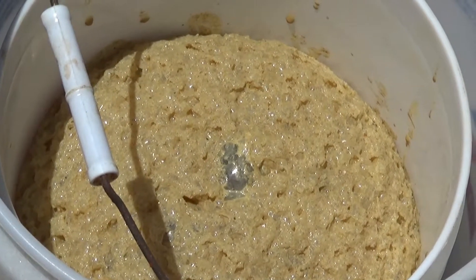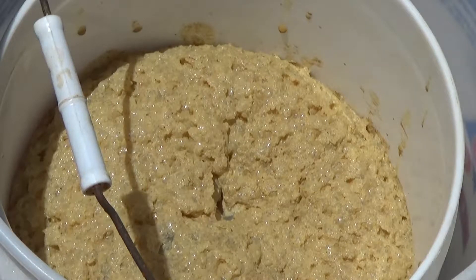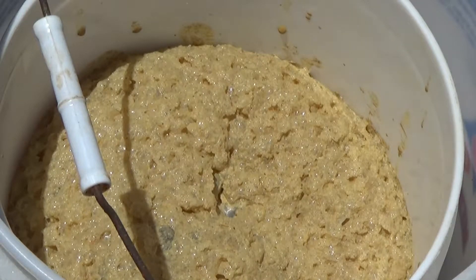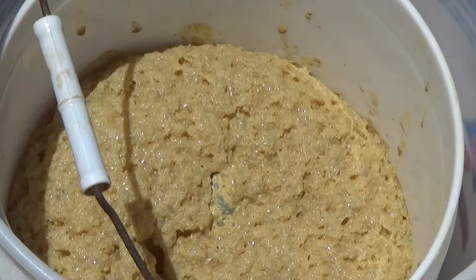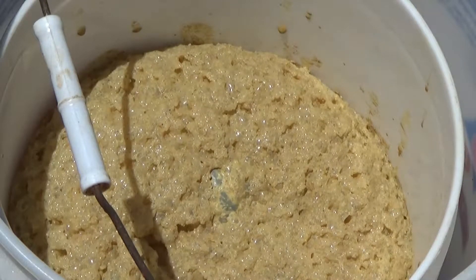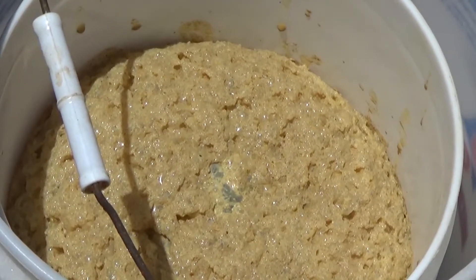This is about three pounds of Telluride ore, from what I was told. It's in H₂O₂ and we're just going ahead and letting it react. We put it inside this bucket so that if there was any spillover, we'd be able to protect it.